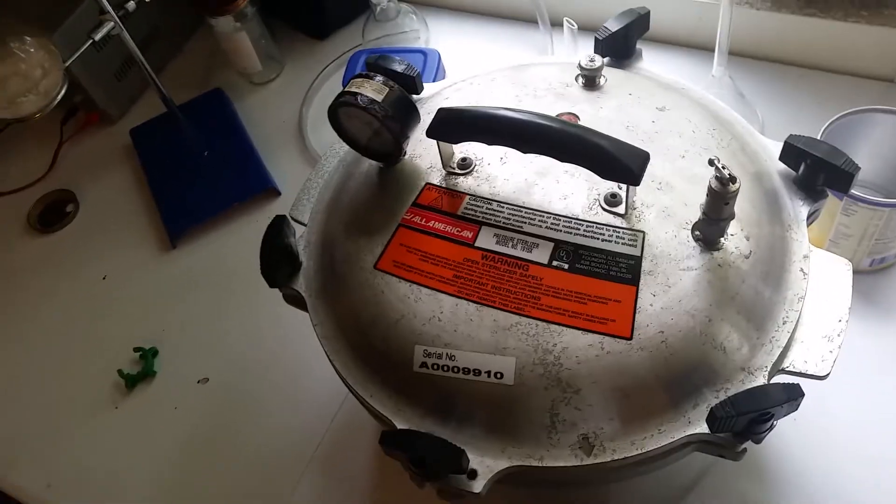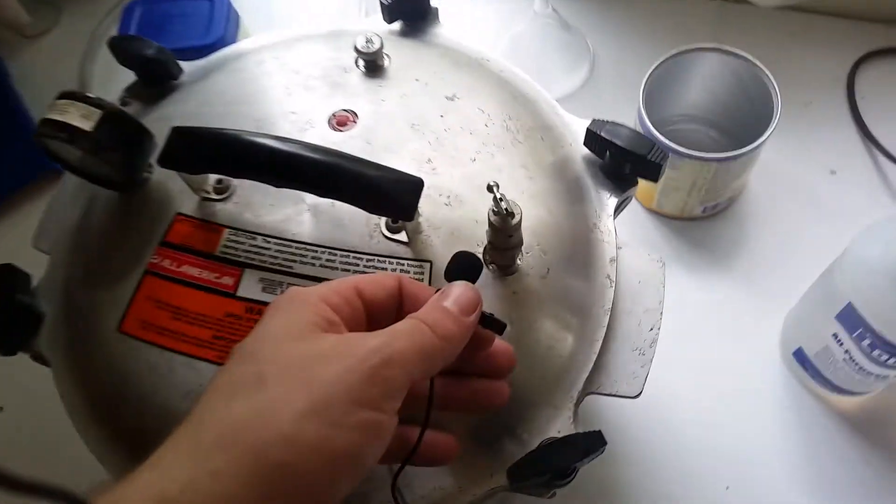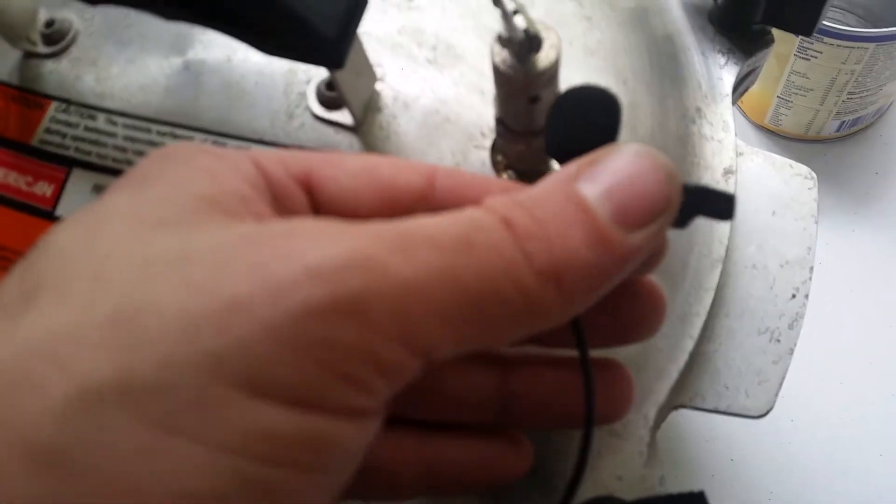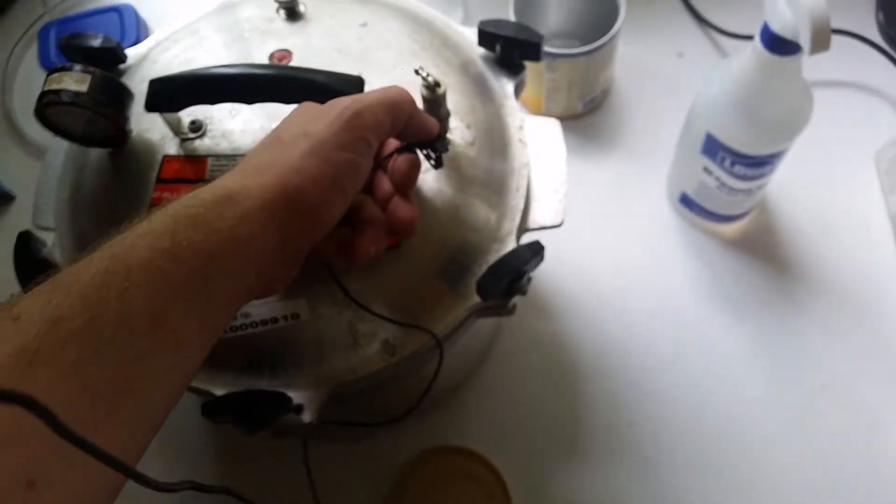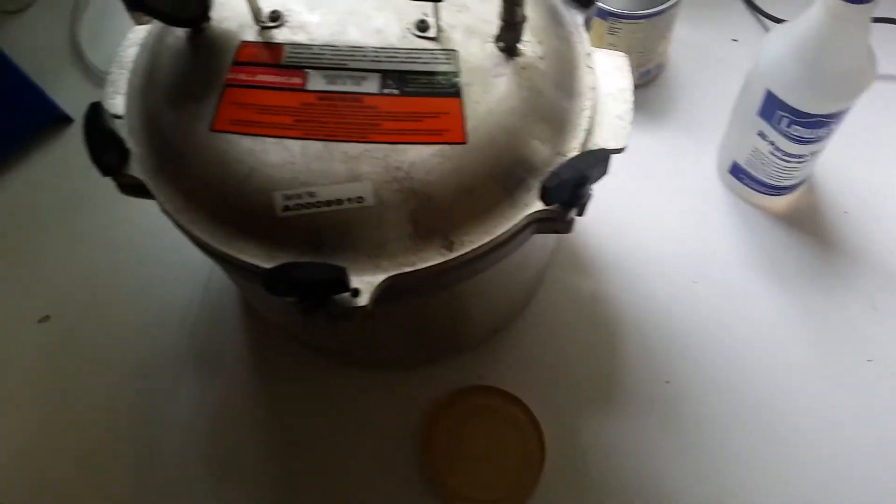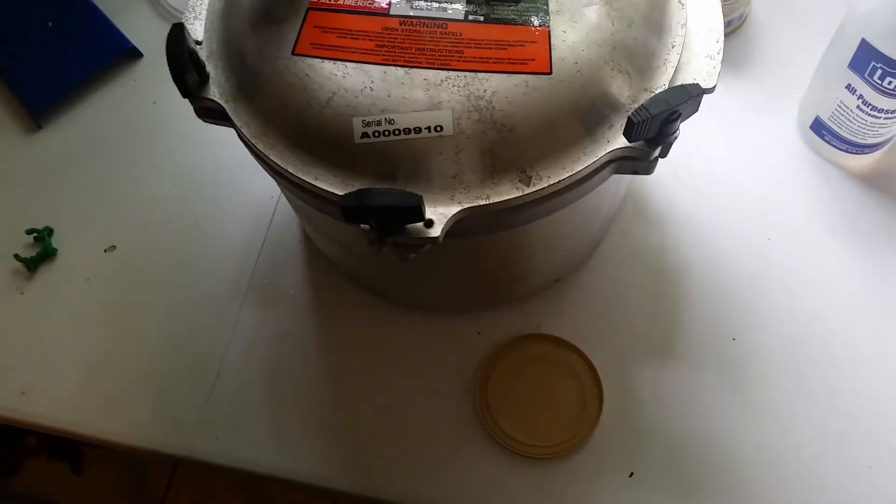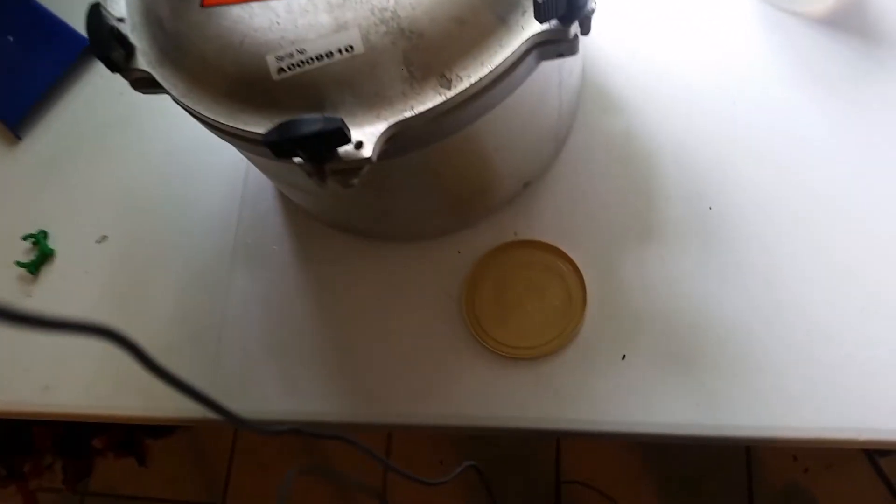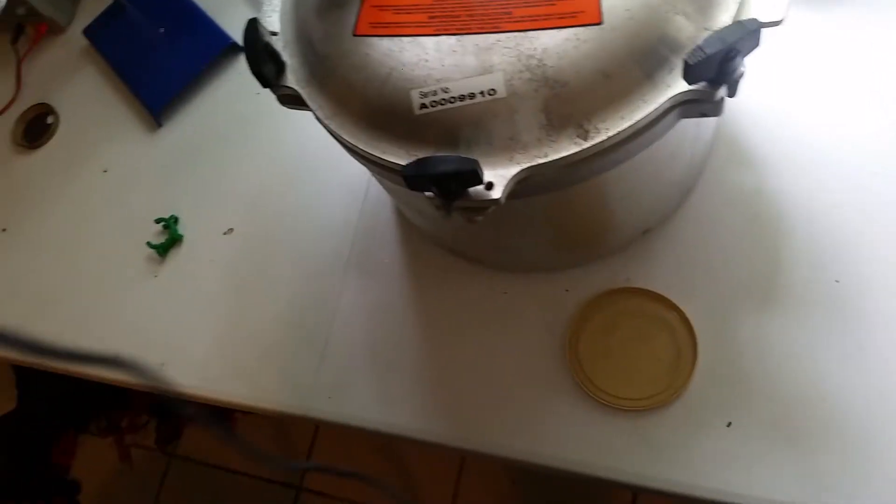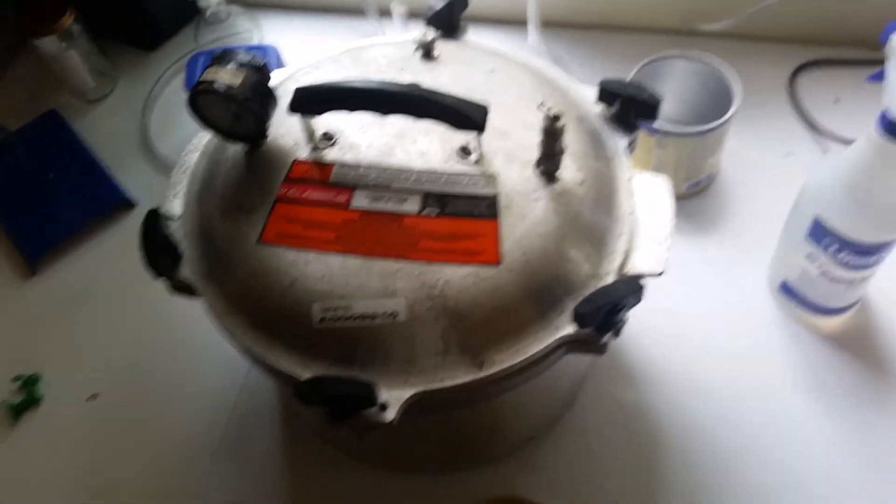So here I was thinking I got all the leaks fixed because it was building pressure. And I went to go check in on it again, and I hear yet another leak. And I think it's coming from this release here. See, I'll put the mic up so you can hear it. So it's looking like I'm gonna have to, I mean I'll let this sit. It doesn't sound like a fast leak. But I'm supposed to let it sit for two to four hours at room temperature. So I doubt it's gonna hold pressure for that long. I'll let it sit for as long as it does hold pressure. And then once it's done, we'll open it back up and see if we can't fix this other leak here.